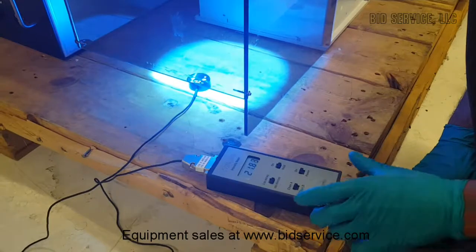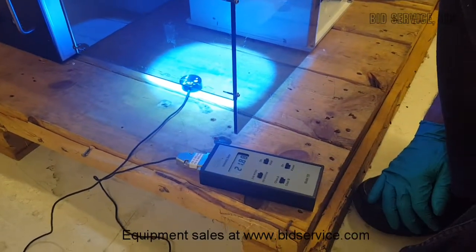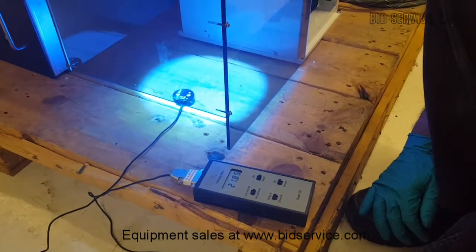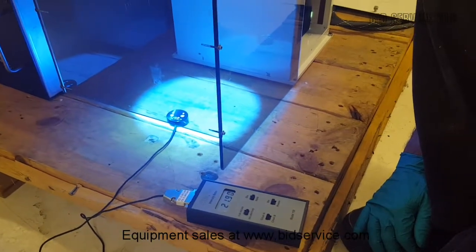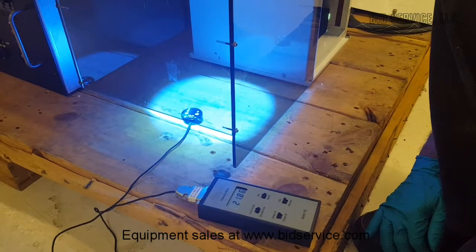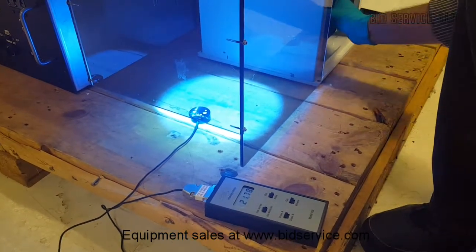In the user's manual there's a formula for how to calculate the uniformity. Typically, lamp uniformity better than 3 to 5% can be achieved with barely adjusting these positions.